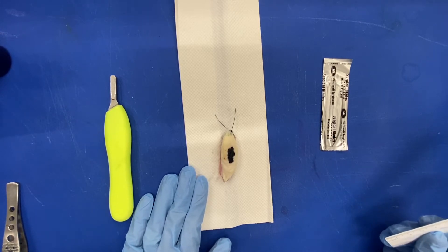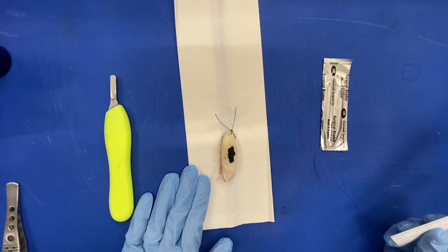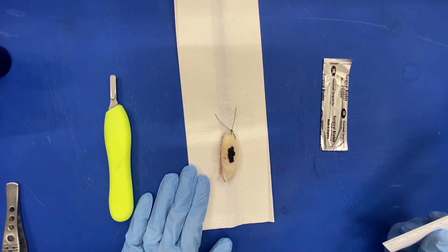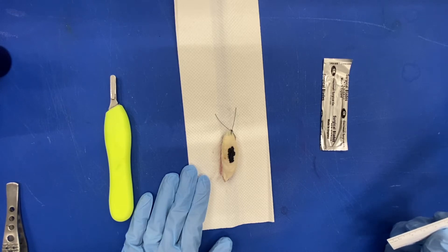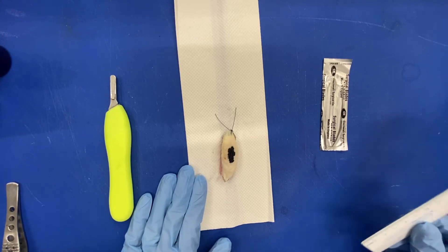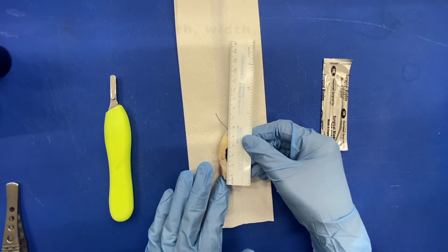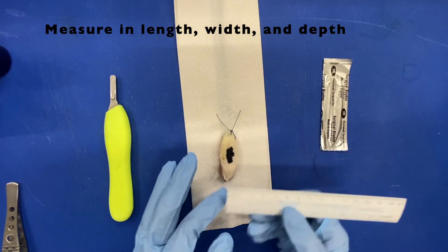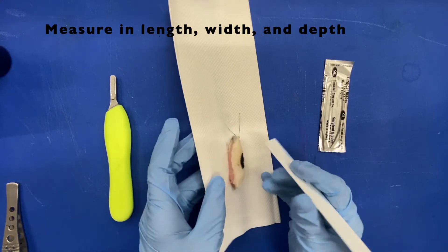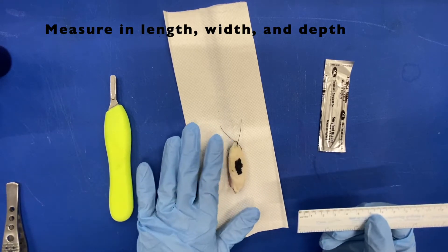So received fresh labeled with the patient name, MRN and open quote left leg skin ellipse close quote period. It consists of an oriented open parenthesis suture equals 12 o'clock close parenthesis tan skin ellipse open parenthesis 5.8 centimeters in length by 2.2 centimeters in width by 1.1 centimeters in depth.